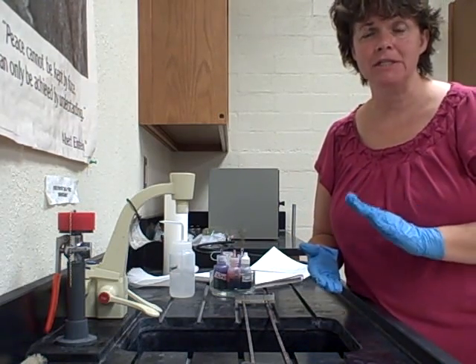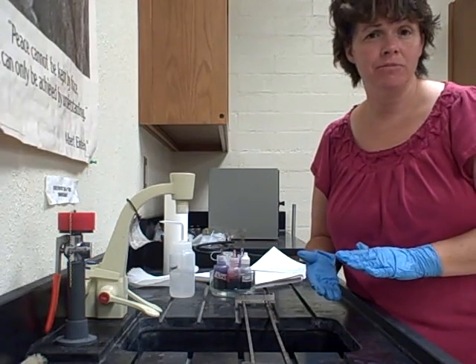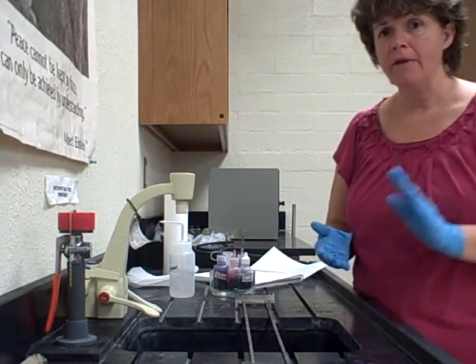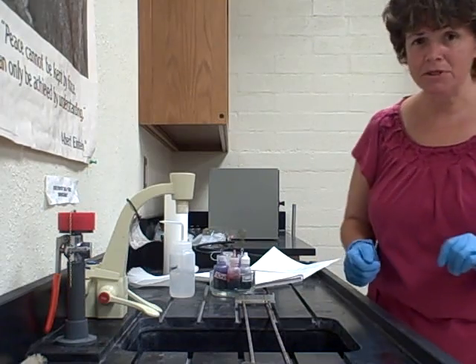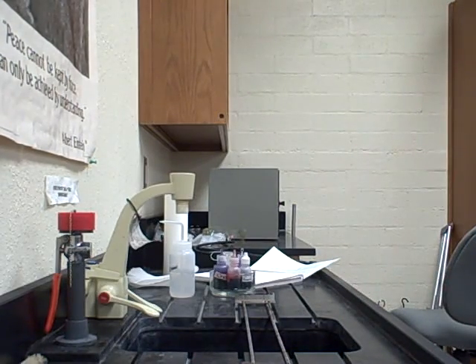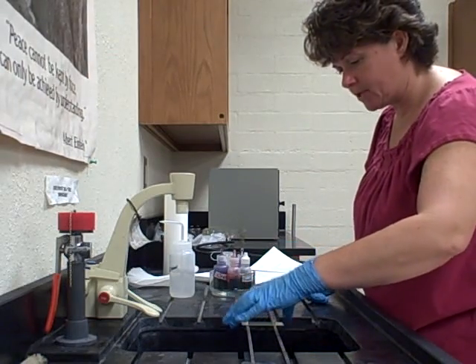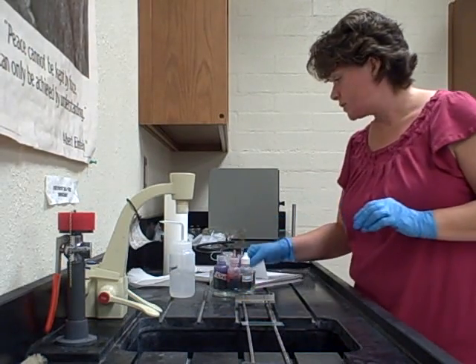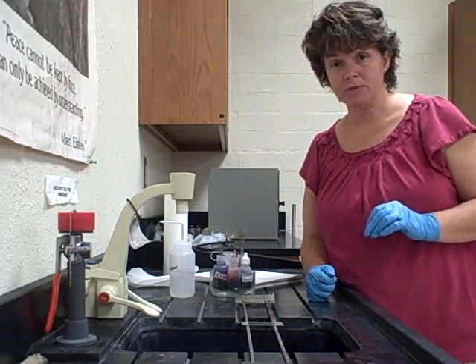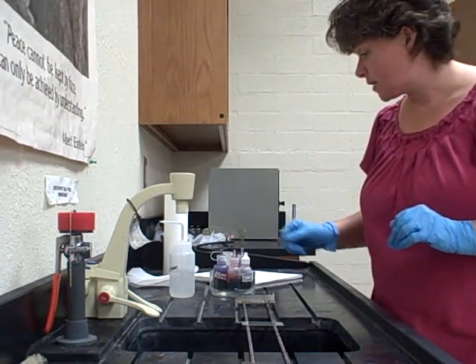Remember, you need to do that every time before you do a staining procedure unless otherwise told. Once we've fixed it — I'm going to pretend I have a slide that has been fixed — I'll go to page 36 where it has the actual gram stain procedure.